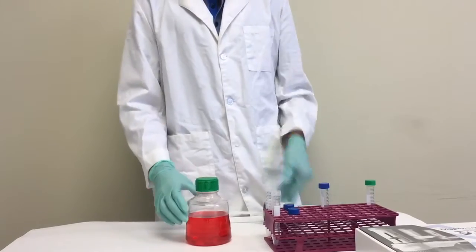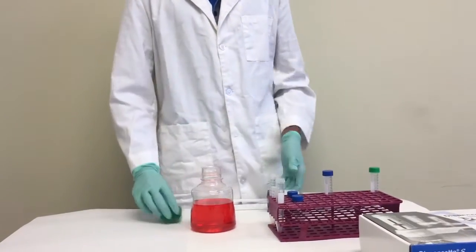Then, screw the dispenser onto the bottle. Also, make sure that it's screwed on tight.